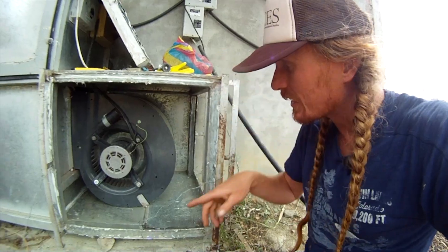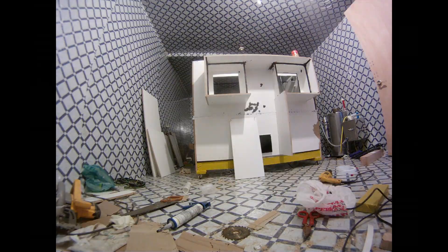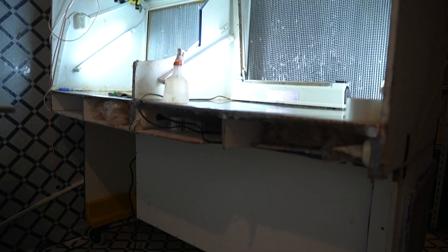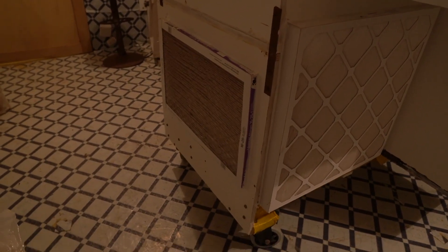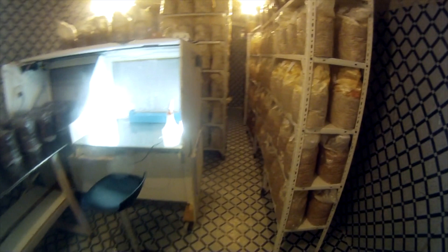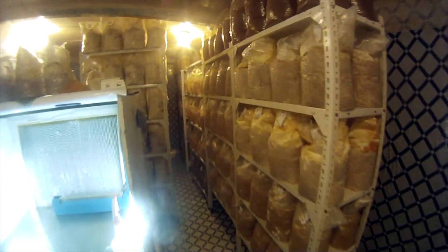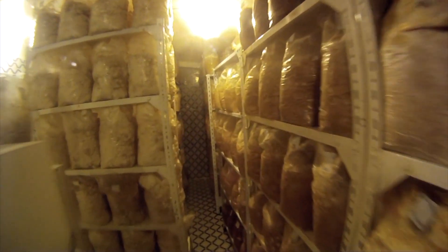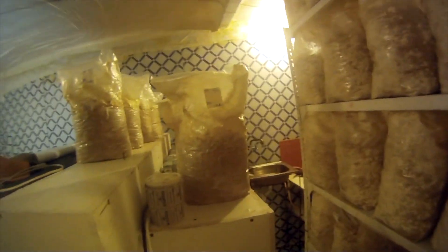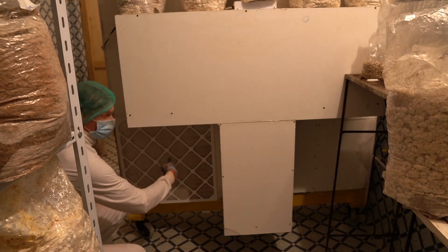I never took video of the Dayton swap, but it looks like this one I use on the outside. If you're in the States, I highly recommend Dayton — it's a quieter, nice fan. I put it in this enclosed box and I use pre-filters. Plenty of people would ask why, but I did it for two reasons: one, to keep the sound down a little; and two, you can get a bit of dust kick-up in your lab. I thought it would protect my fan, and those are filters I'll basically never have to replace.